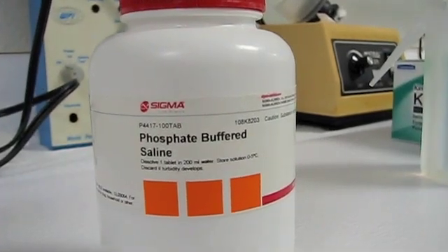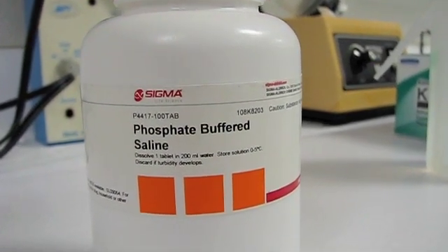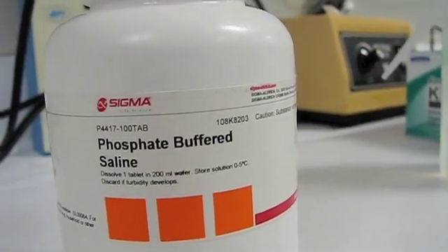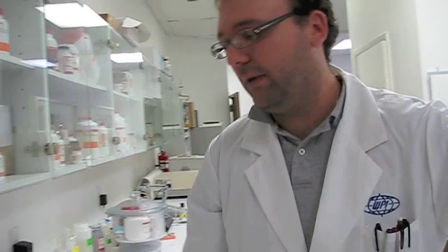One thing that's important to note is when this is dissolved, this is a solution of phosphate buffered saline. So an important point to note is that there are some other components, so make sure you note that in your experiments and research that it is a solution of PBS.